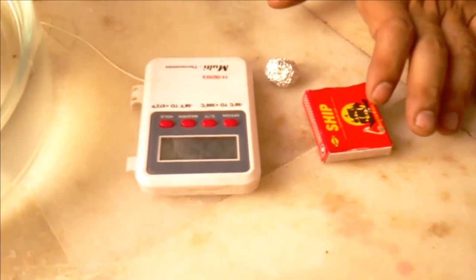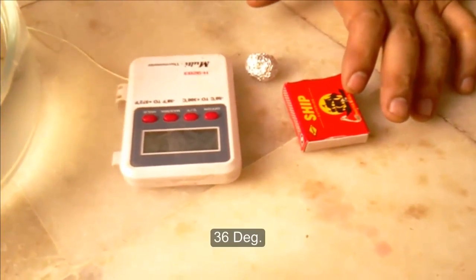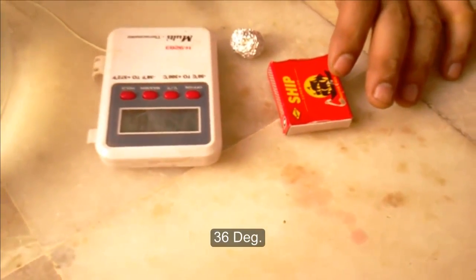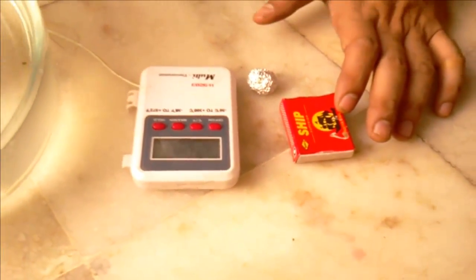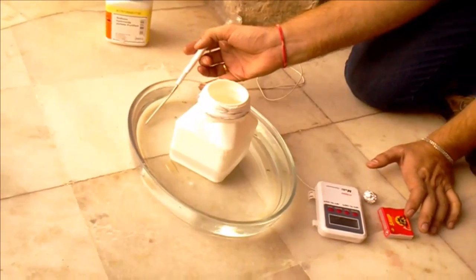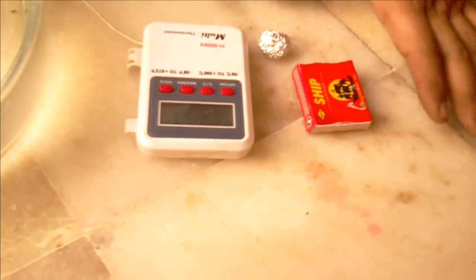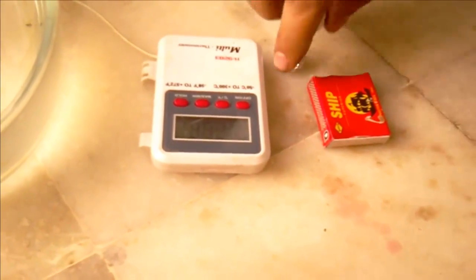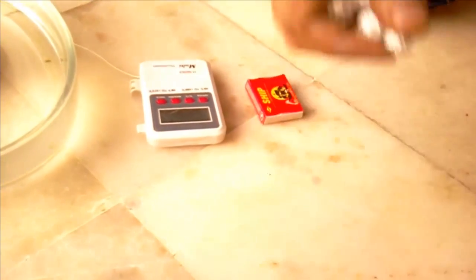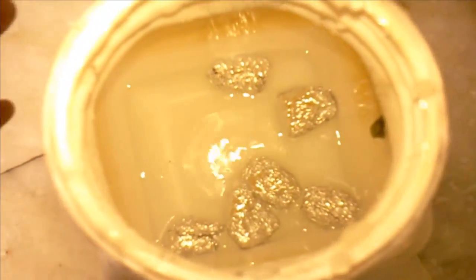This is 36 degrees outside. That is 40 degrees inside, maybe more. And outside — so now I am putting these balls in. The reaction has started.